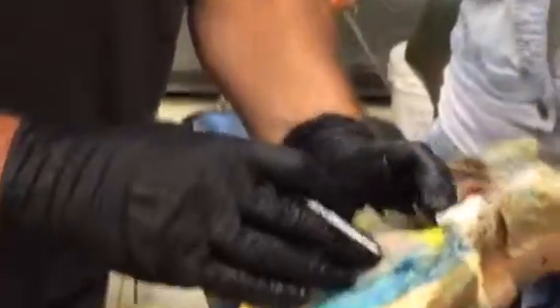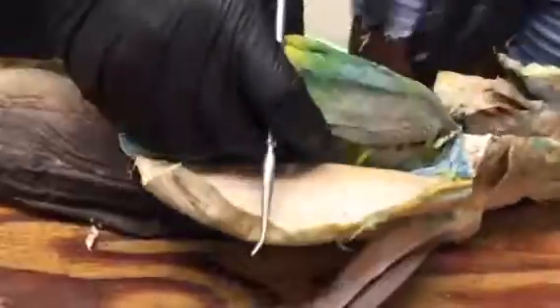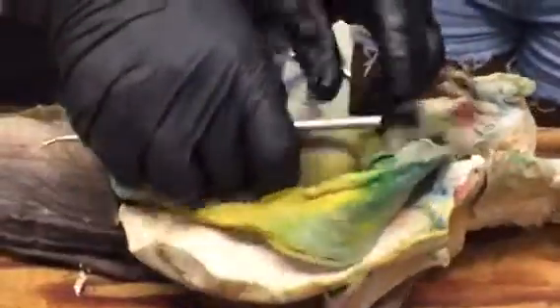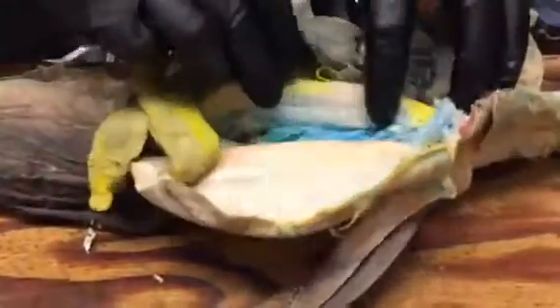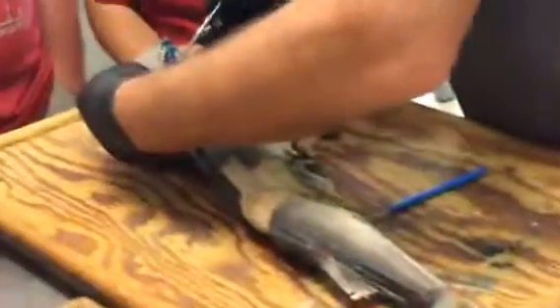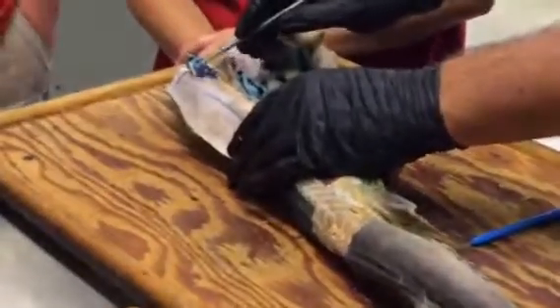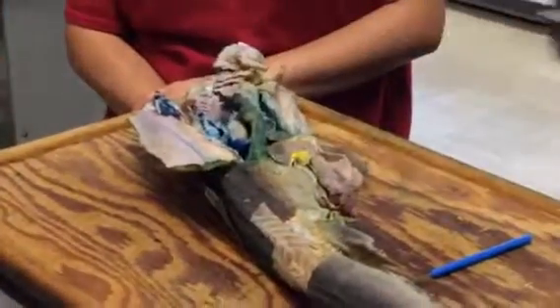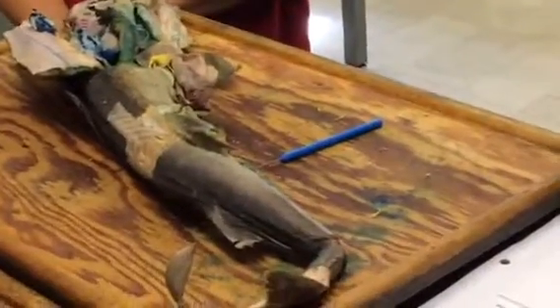Anterior ventrolateral artery. Okay. I don't know why I put that one on the list because it's not really. I think you can see it on either chart. Right about here, is that it? There's a faint line right there. Is that red? Yeah, that is red. Right there. Okay. So that would be anterior ventrolateral artery. It's anterior, and it is ventrolateral, and it's in the body wall, so cool. I'm not too worried about that one for what it's worth. But then the next four are really important.